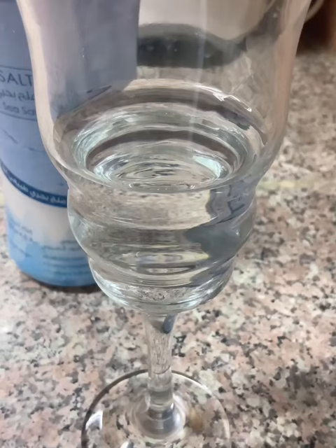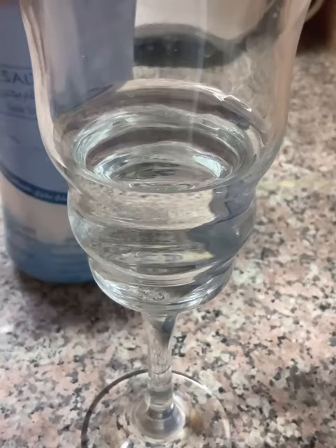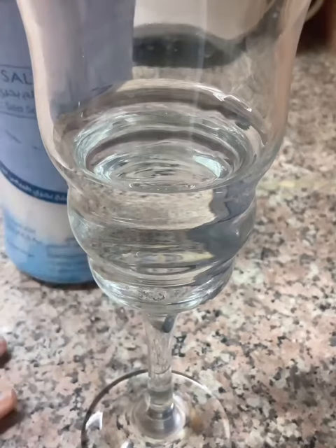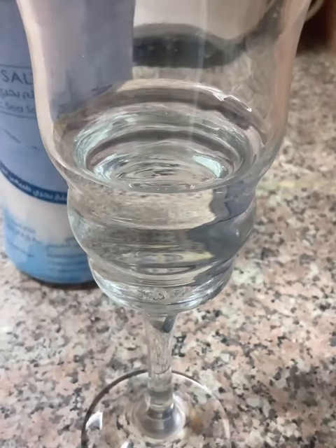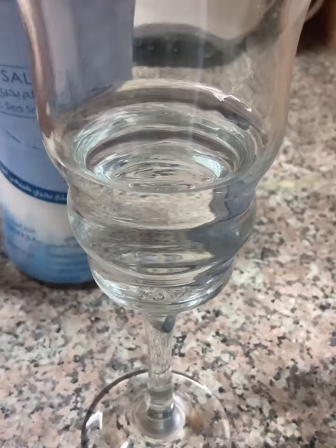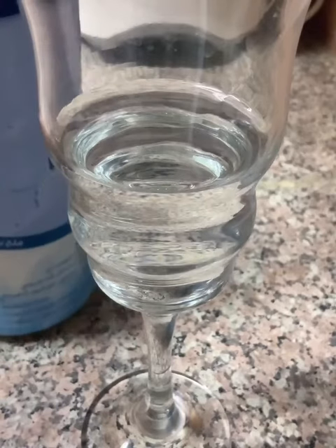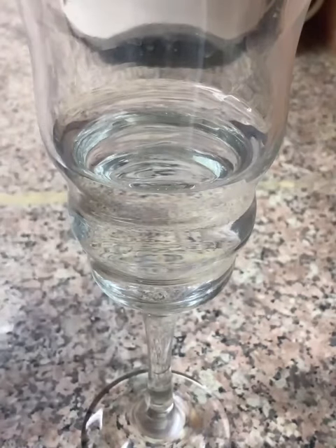Today we're going to do some solubility, which is salt and water. So let's start mixing it and then I'm going to say what will happen and explain.